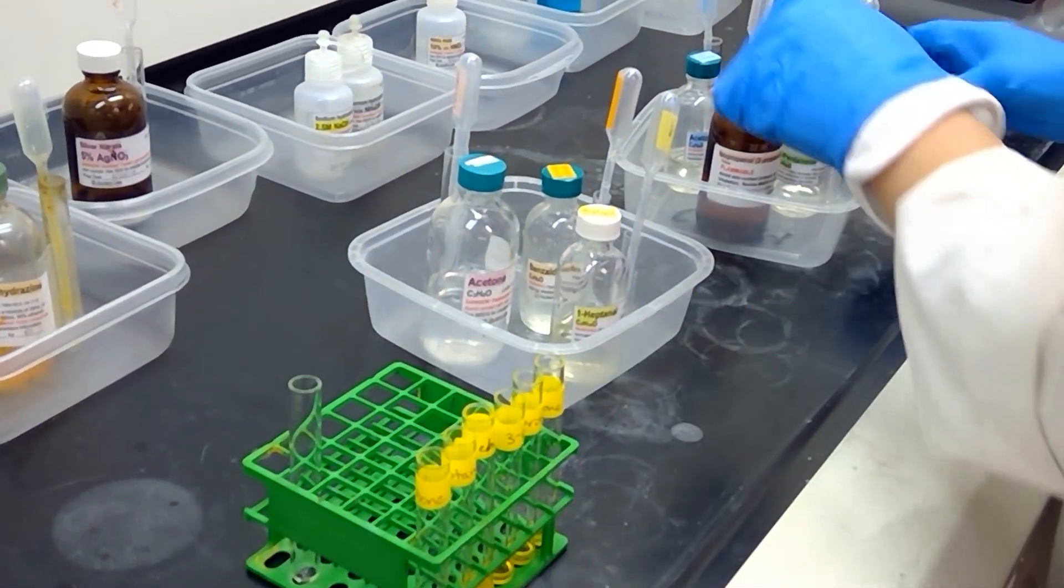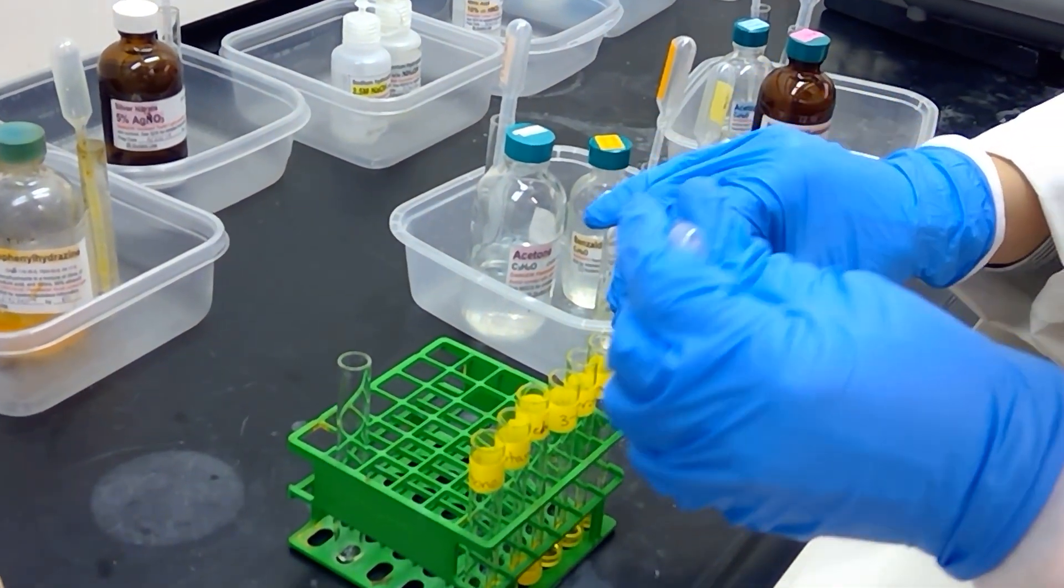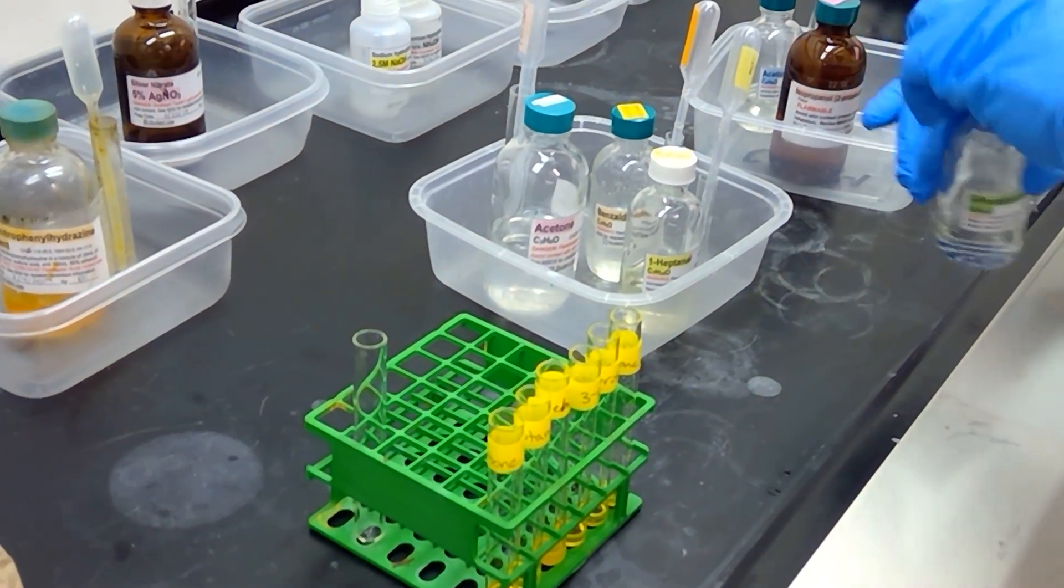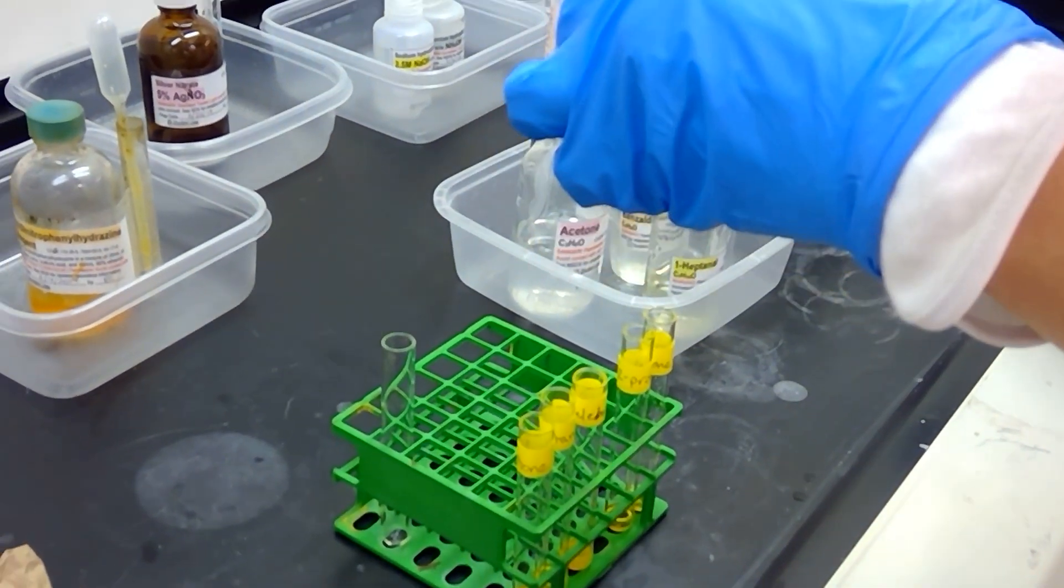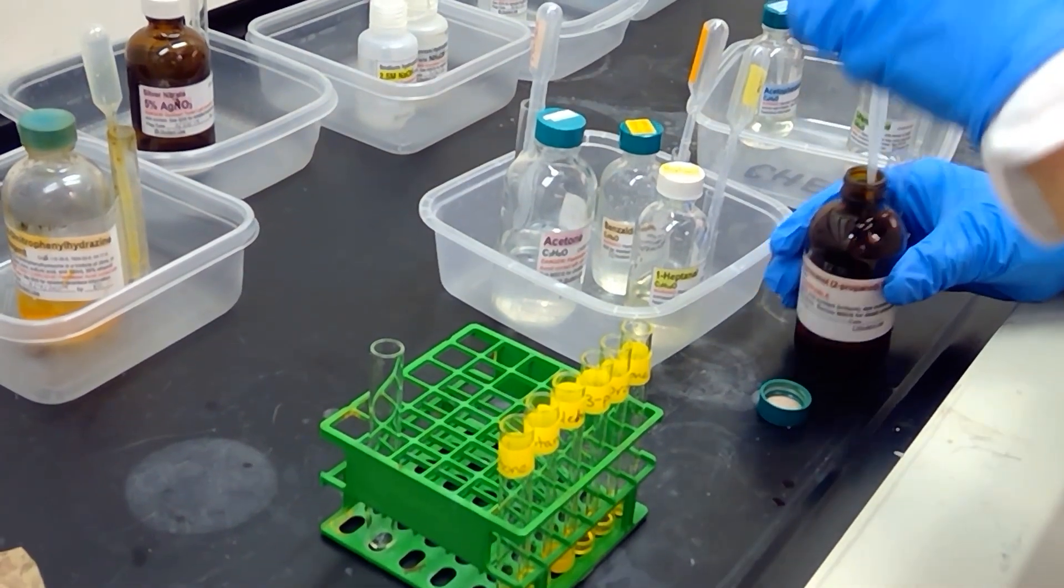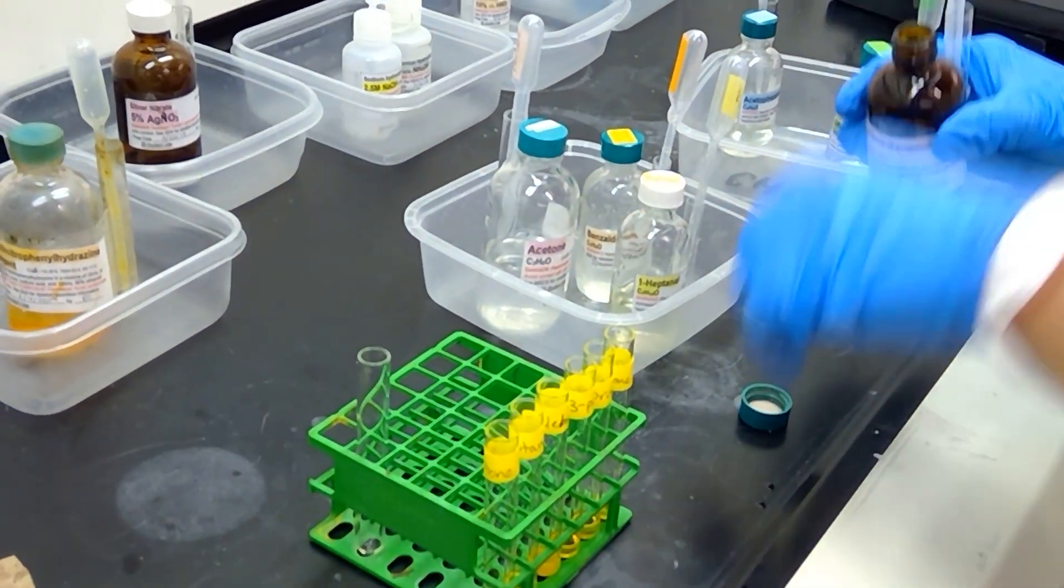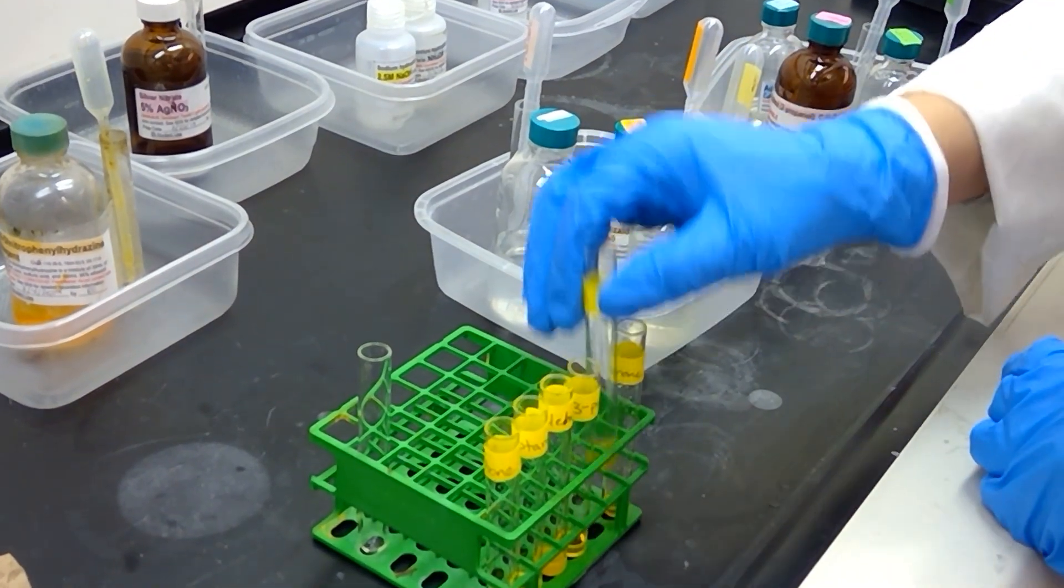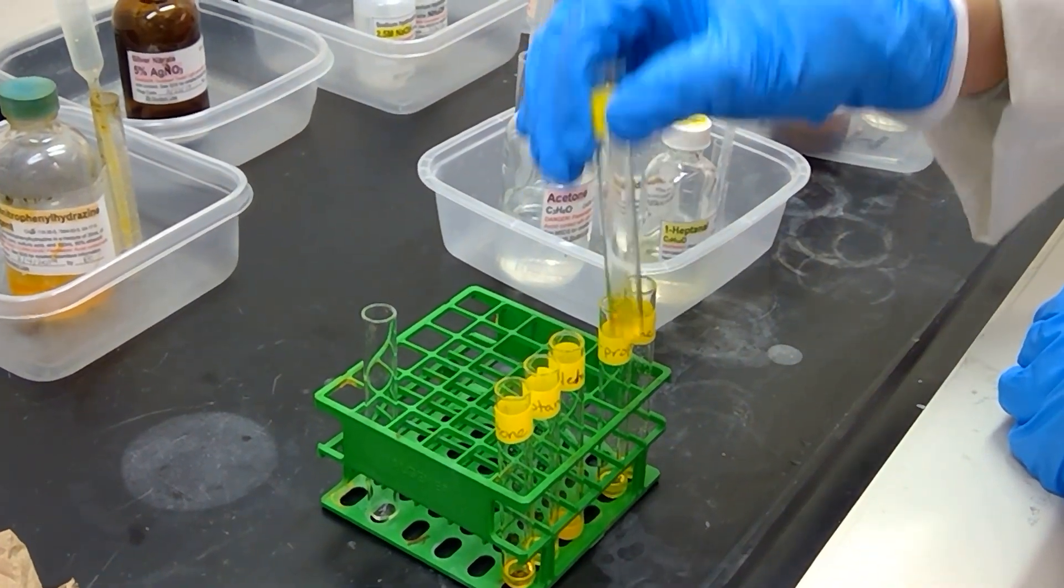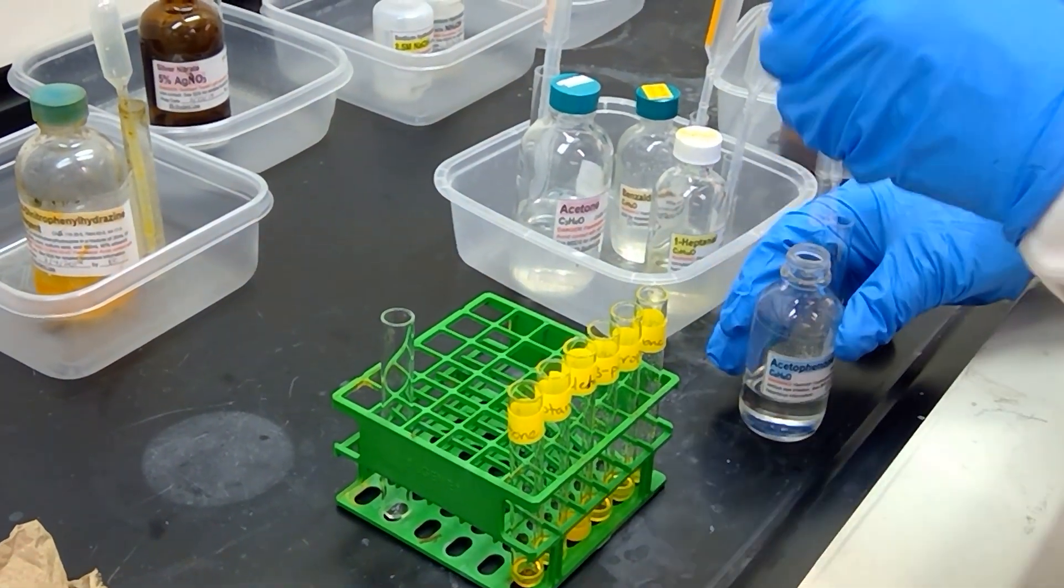Next up, we will have 3-pentanone. I'm going to shake that up just slightly. We'll look at 2-propanol. And last but not least, we will add some acetophenone to the last test tube.